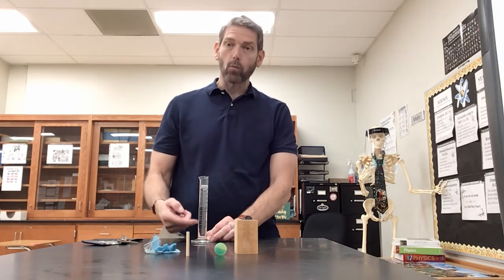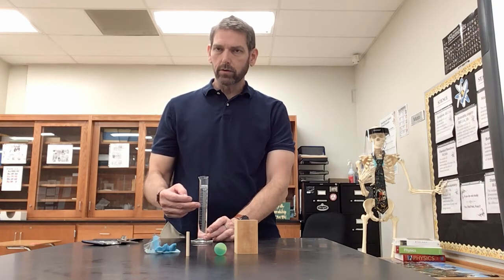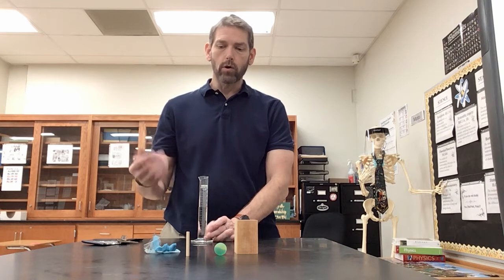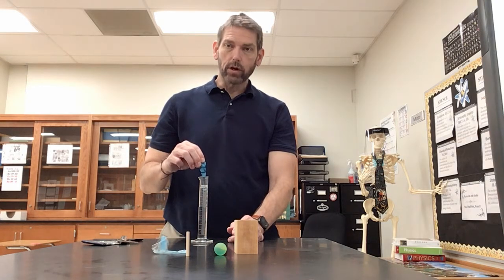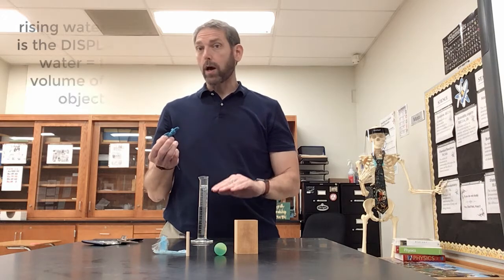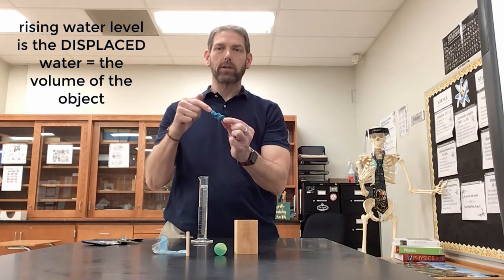And so this one I already have some water filled up in it, and typically you use water for this. So you would fill the graduated cylinder up to some mark. It doesn't matter where you put it, you just need to make sure you have enough water. And then if you were to take this object and drop it into the graduated cylinder, well, what's going to happen? We know the water level that's already there is going to rise up, and that rising water level has to be the amount of space that this object is taking up.